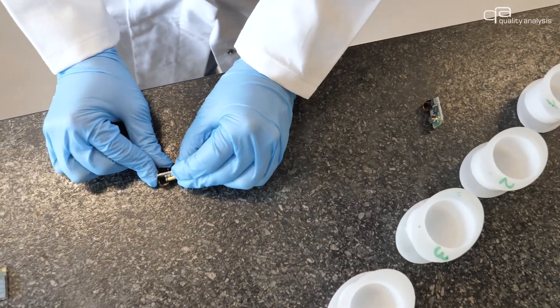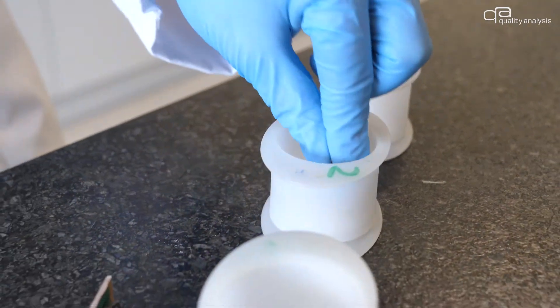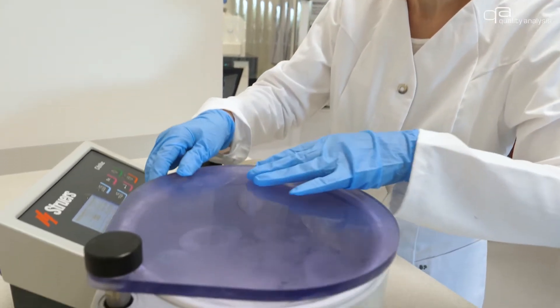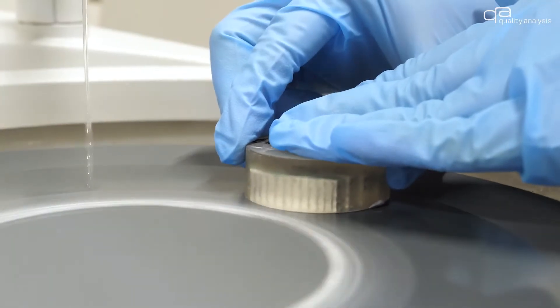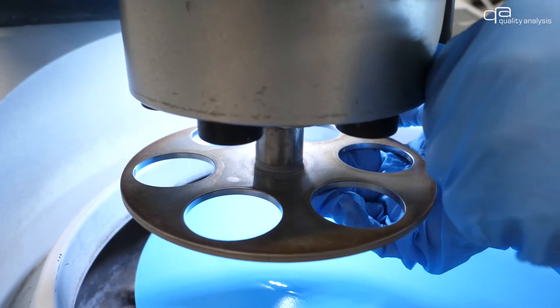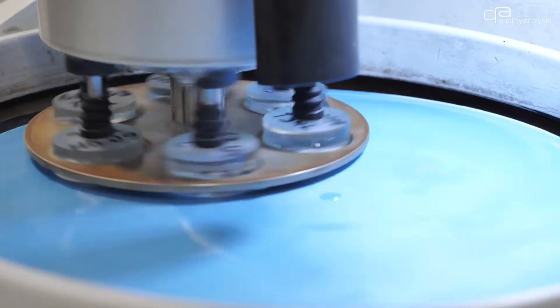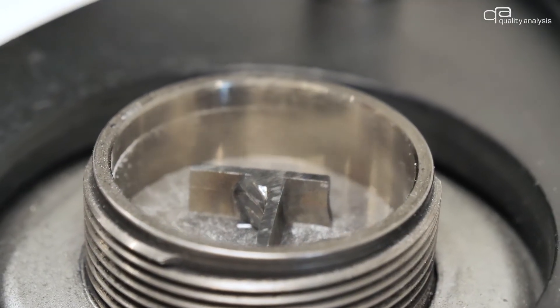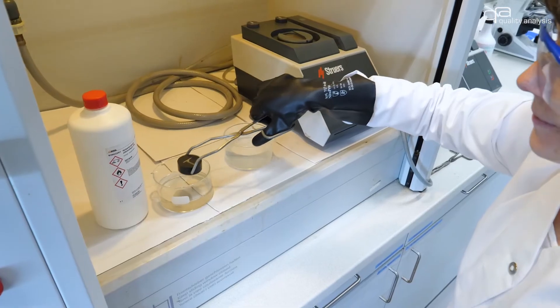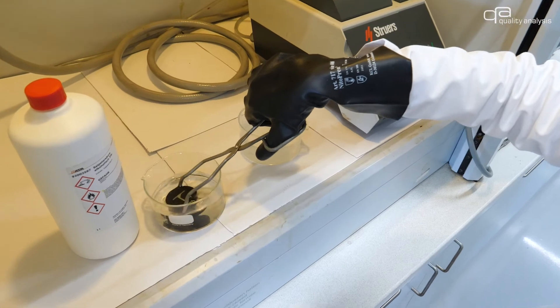Following the cutting process, the separated component is embedded in an electrically conductive or non-conductive matrix. The position to be examined is reached by grinding and polishing steps in the micrometer range. Depending on the embedded material and the objective of the examination, a specific etching of the surface is performed afterwards.